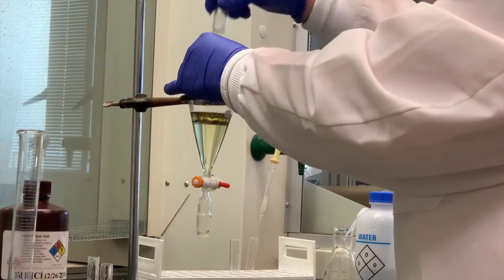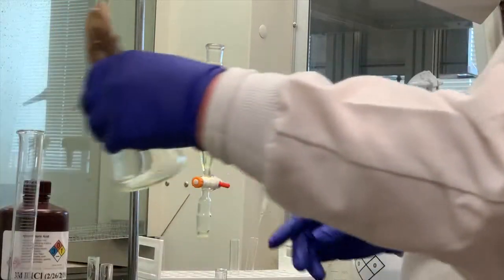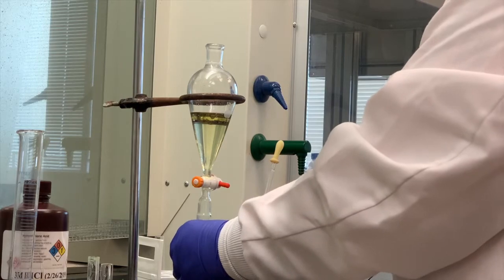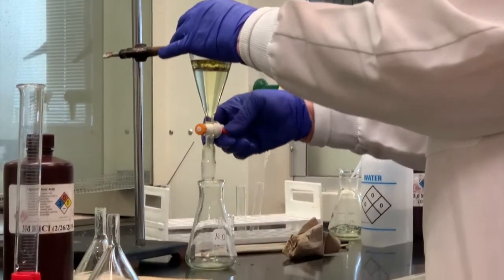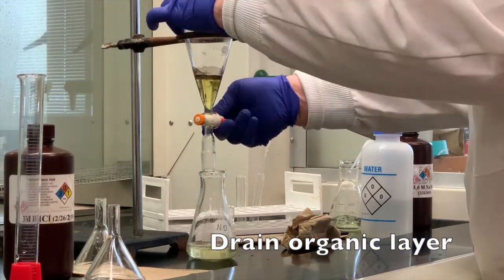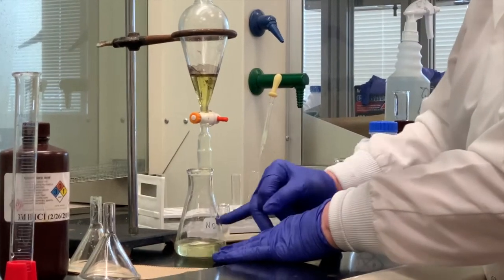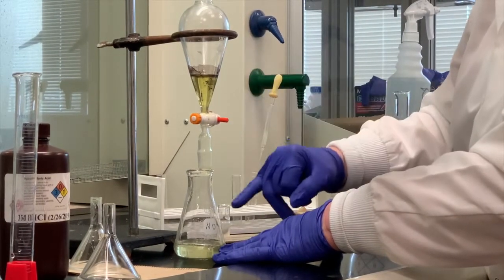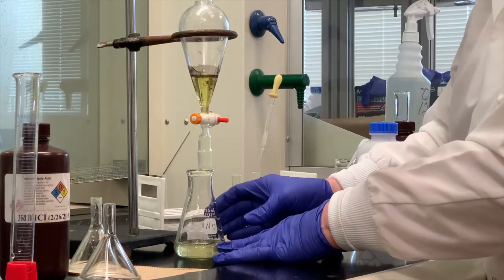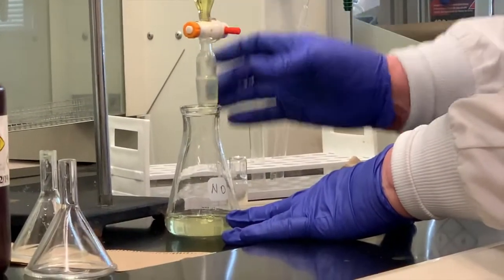So I'm going to remove my stopper. I'm going to take my neutral organic, and I'm going to collect the organic separate from the aqueous acid. Now notice I did let a little bit of the aqueous layer go into the neutral. If I would want to stop at this point and not wash it again, I would be concerned with that. But remember what I'm going to do.